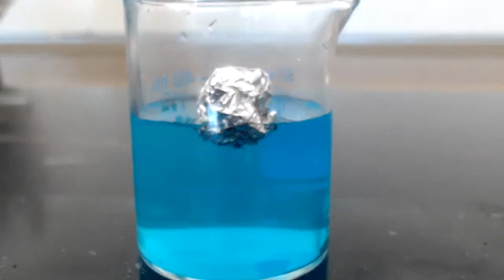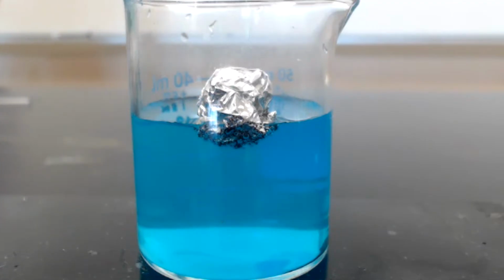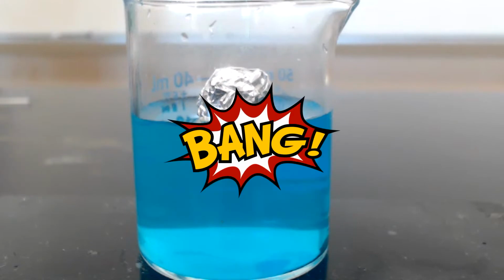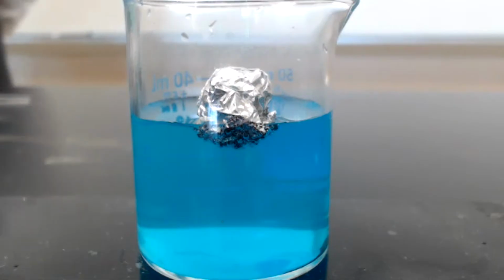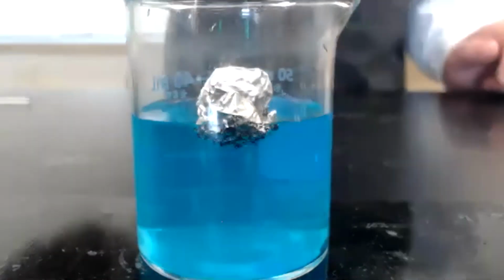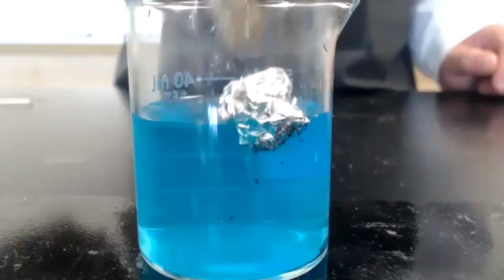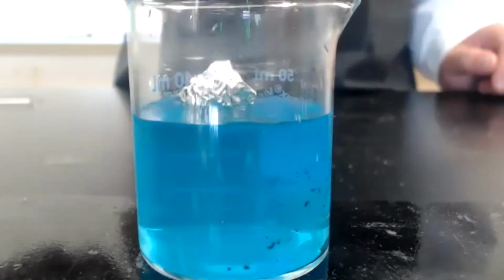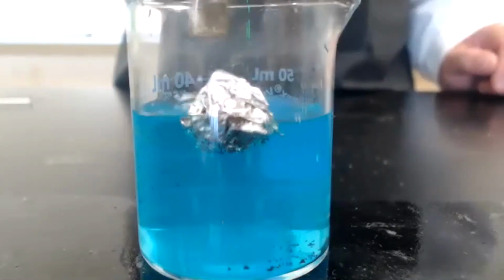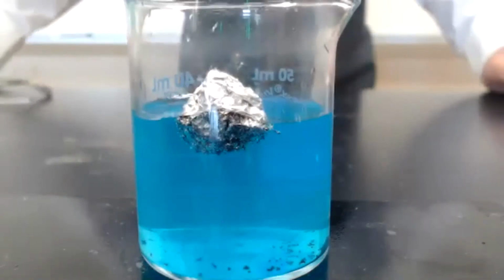If you look closely, you will notice small bubbles forming on the bottom of the aluminum foil where it's in contact with the copper 2 chloride solution. You will also notice a brown precipitate forming. If I tap the aluminum foil, you'll notice I can get some of those brown flakes to fall off to the bottom.